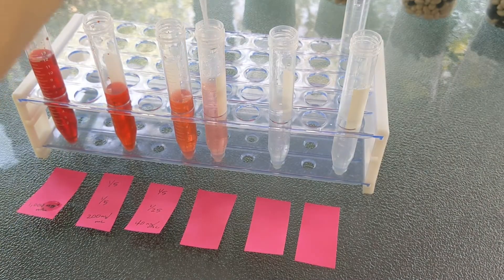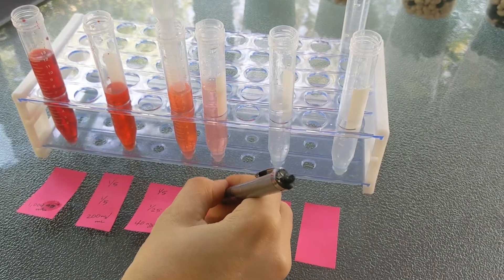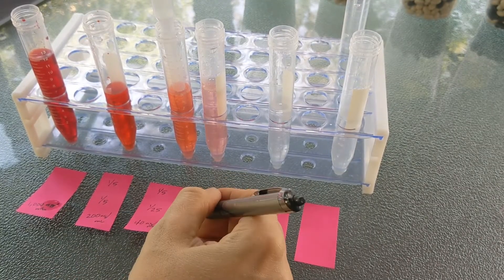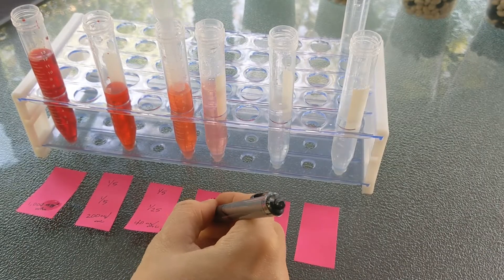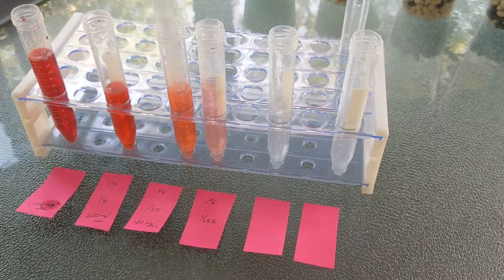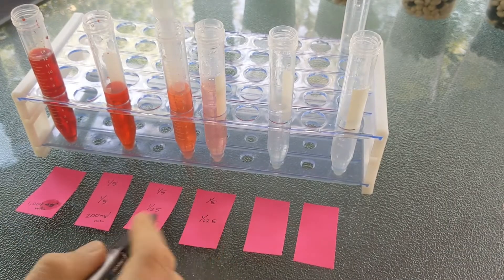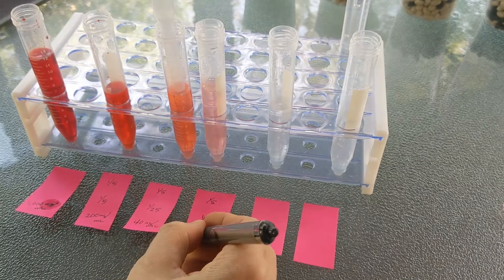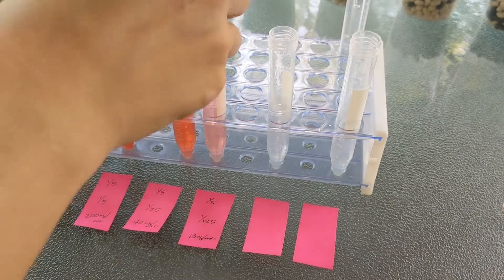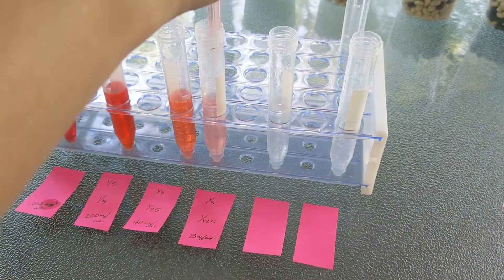Then we do it again. This is the last one I'll do for you, and then you do the rest. One-fifth of one twenty-fifth — just multiply the denominators: 5 times 25 is 125. So this is now one one-hundred-twenty-fifth as concentrated as the first tube. And one-fifth of 40 is 8 nanograms per milliliter. I'll continue to dilute these samples and you're going to do the final two on your own.